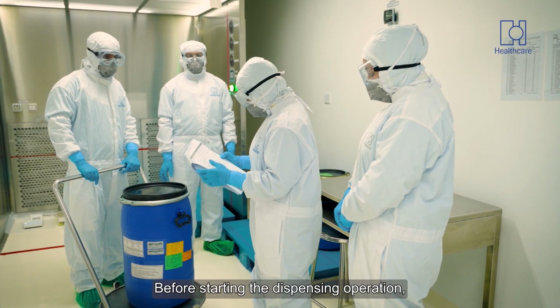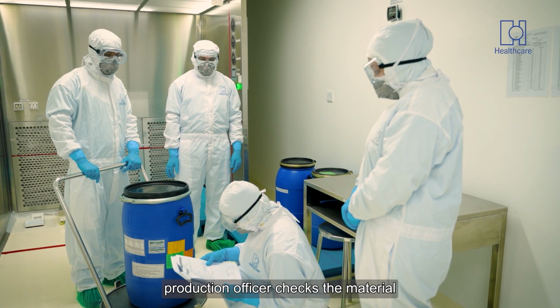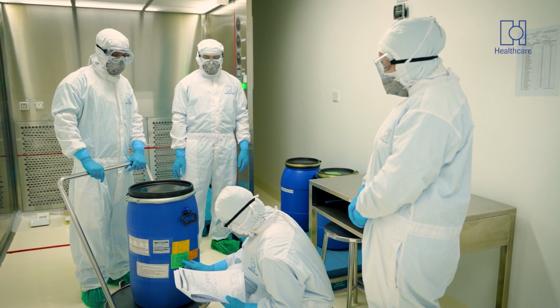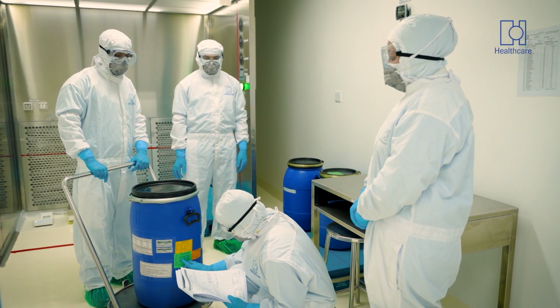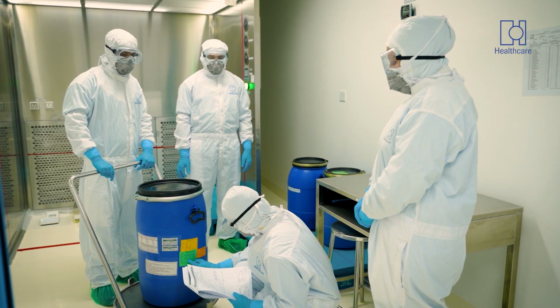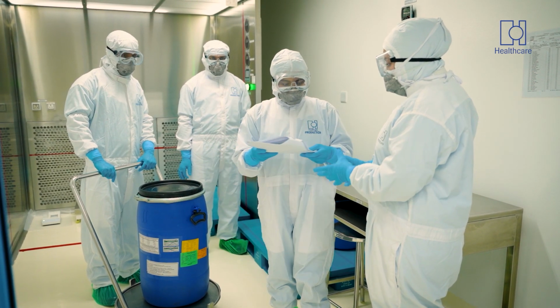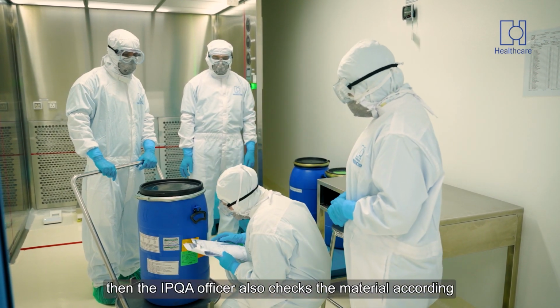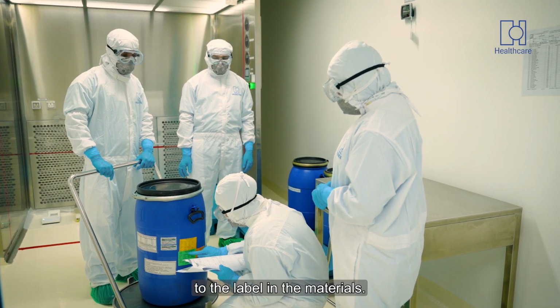Before starting the dispensing operation, the production officer checks the material. Then the IPQA officer also checks the material according to the label on the materials.